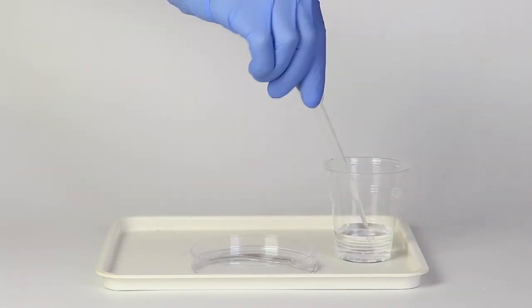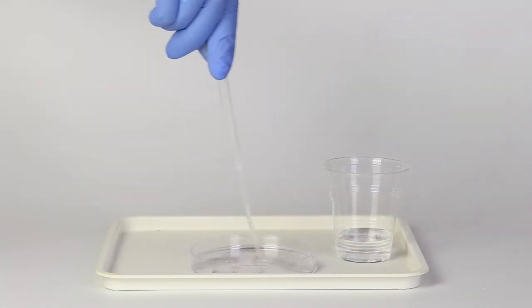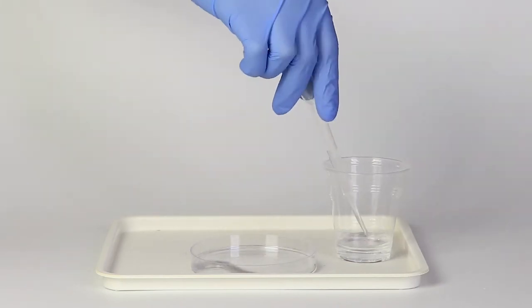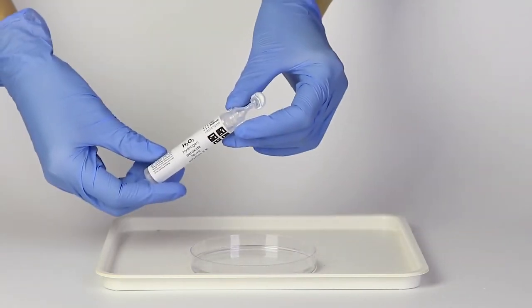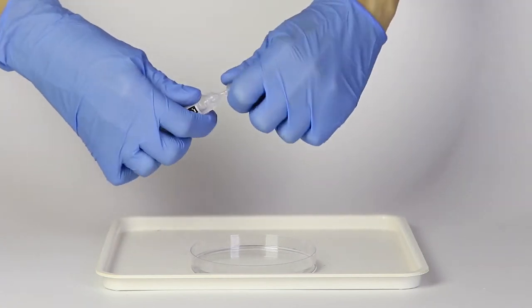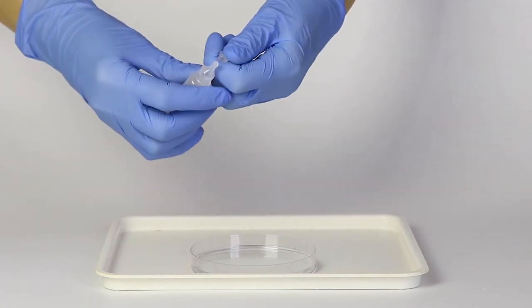Using a pipette, add some water until the solution completely covers the bottom of the petri dish. Then, add some drops of hydrogen peroxide to various spots in the petri dish.